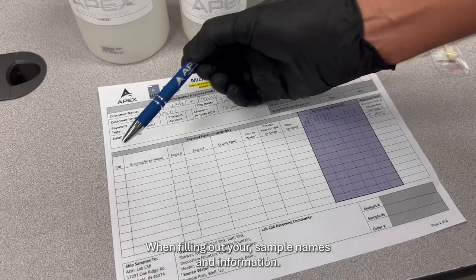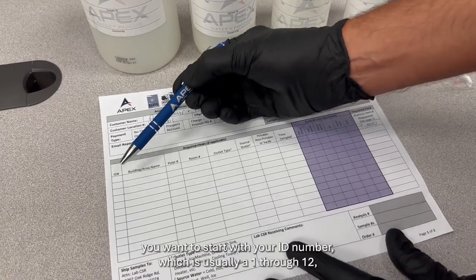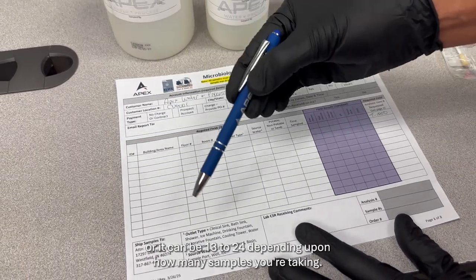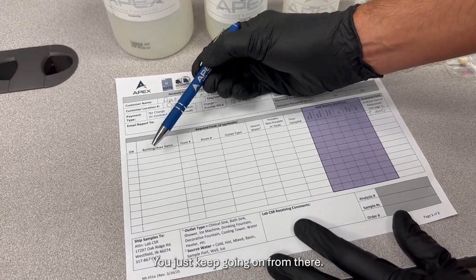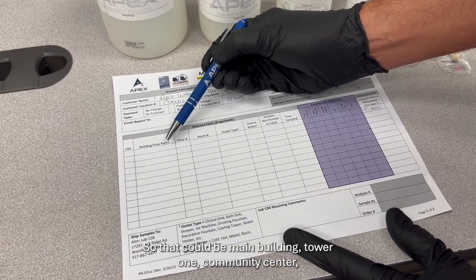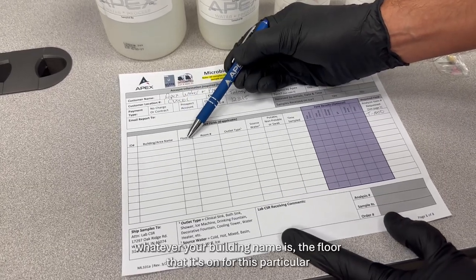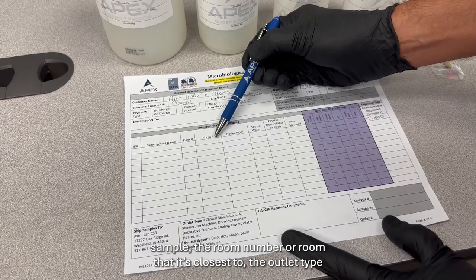Okay, when filling out your sample names and information, first off, you want to start with your ID number, which is usually 1 through 12, or it could be 13 through 24, depending upon how many samples you're taking. You just keep going on from there. You want to make sure you fill in your building or area name. So that could be main building, Tower 1, community center, whatever your building name is. Then the floor that it's on for this particular sample, and the room number or room that it's closest to.